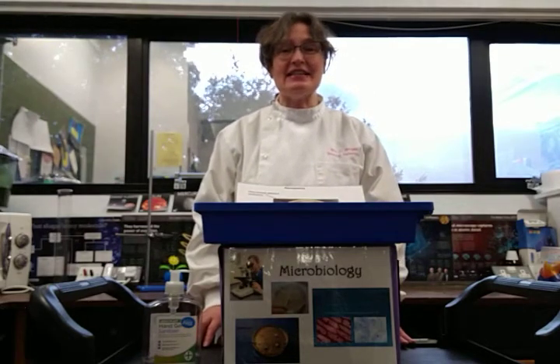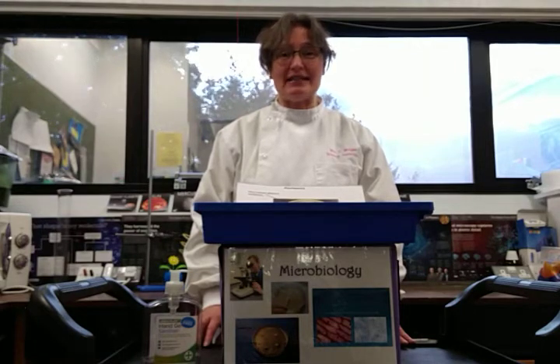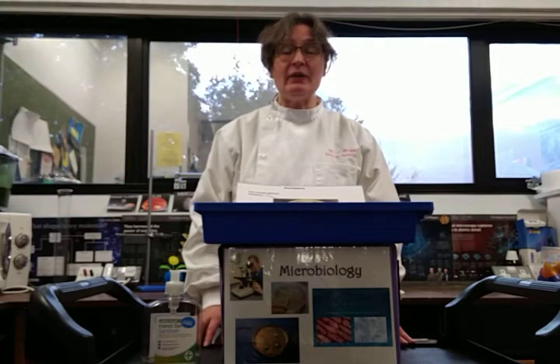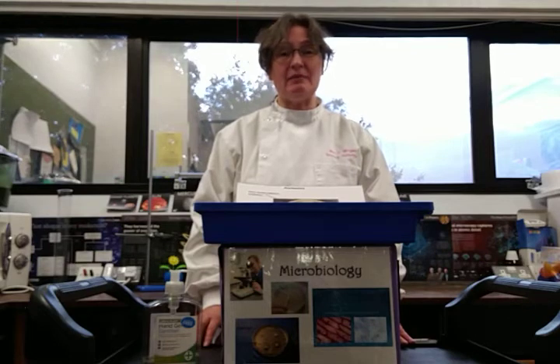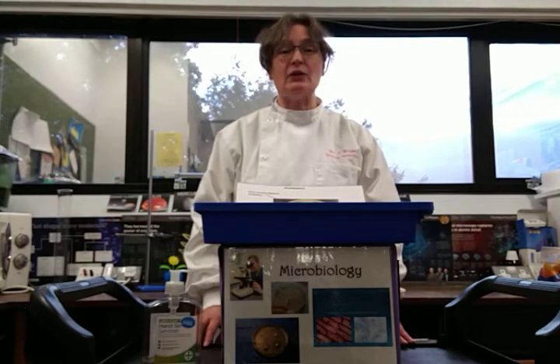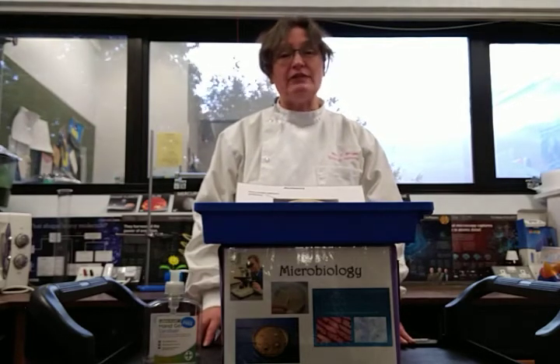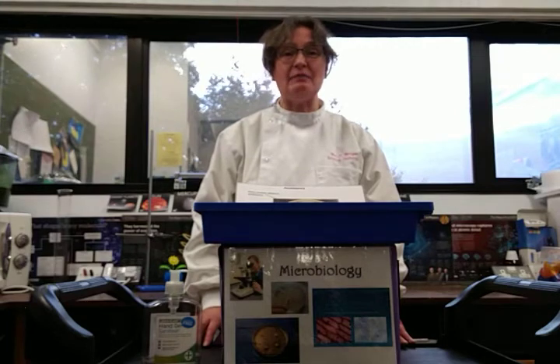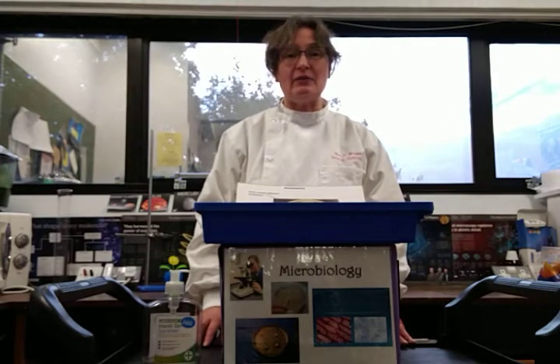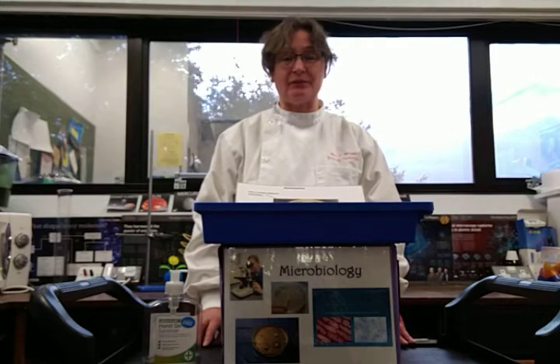This is an investigation into the effect of antibiotics on the growth of bacteria. Whenever we're working with bacteria or any other microorganisms, we have to carry out everything under what we call aseptic conditions. That means we're reducing the risk of contamination by anything other than that which we want to grow in our petri dishes to an absolute minimum.